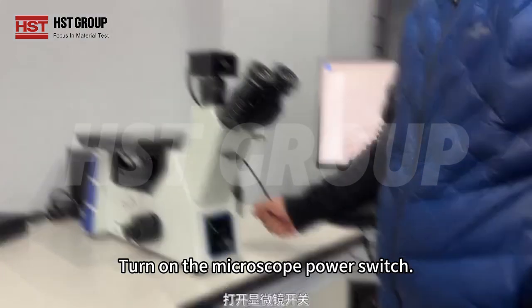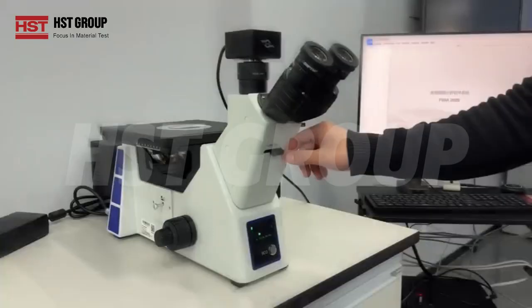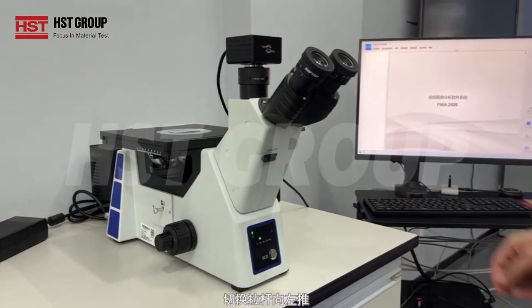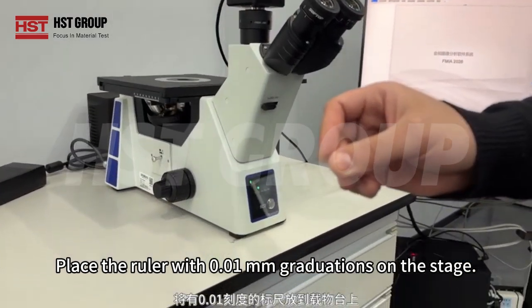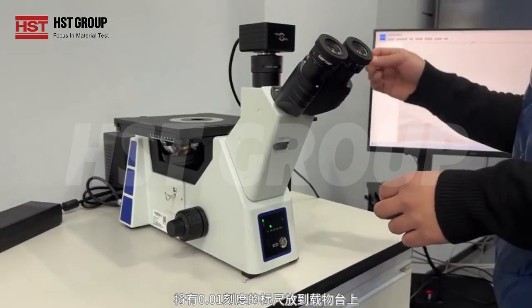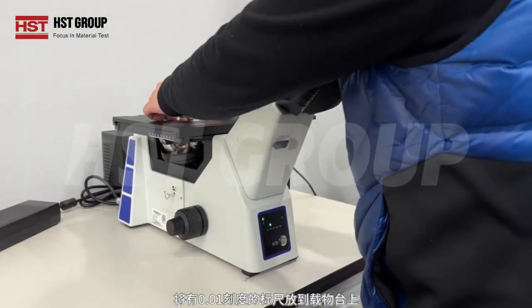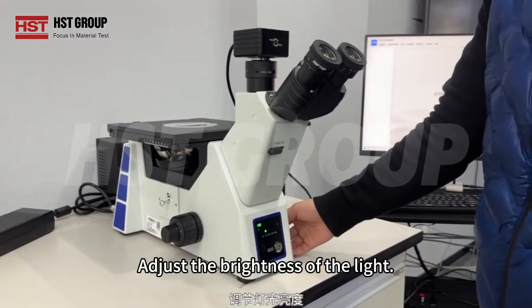Turn on the microscope power switch. Switch to the 10 objective lens. Push the pull rod to the left. Place the ruler with 0.01 mm graduations on the stage. Adjust the brightness of the light.